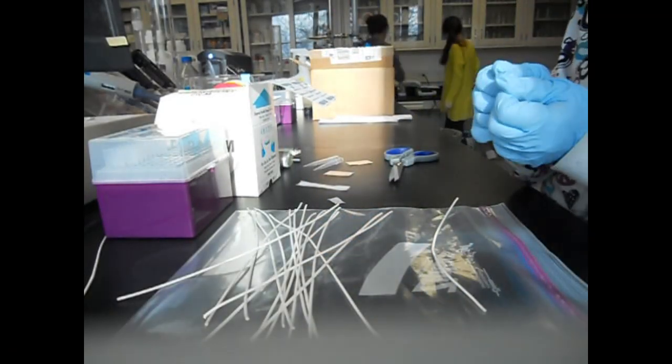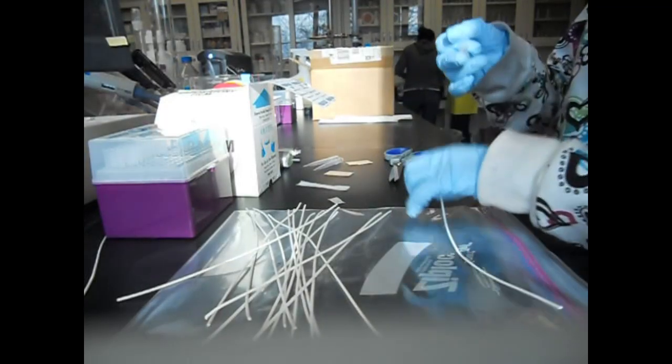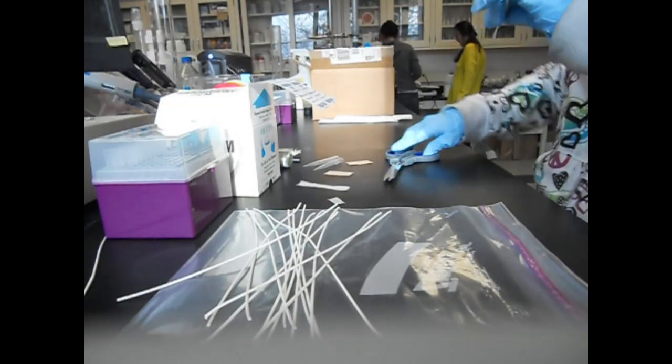Before you put it on, you need to stretch it a little bit, because you want a very thin layer just on one end of these membranes. Then cut off the rest.